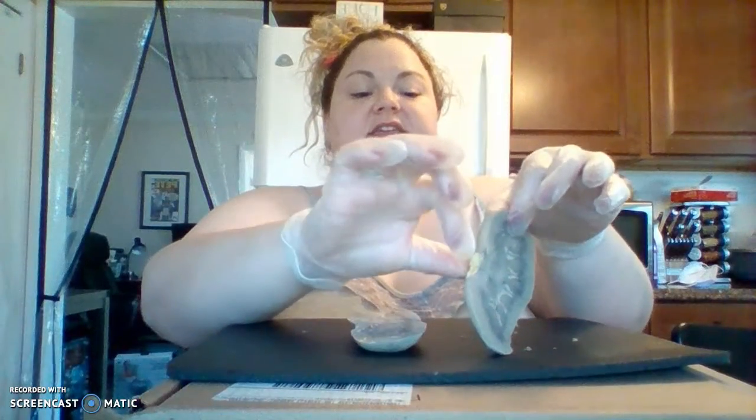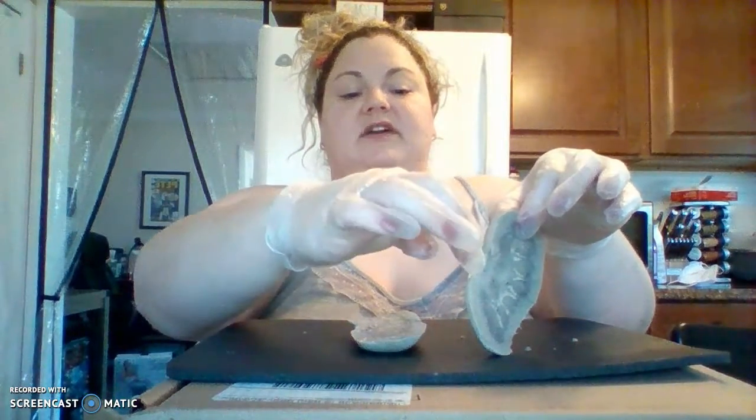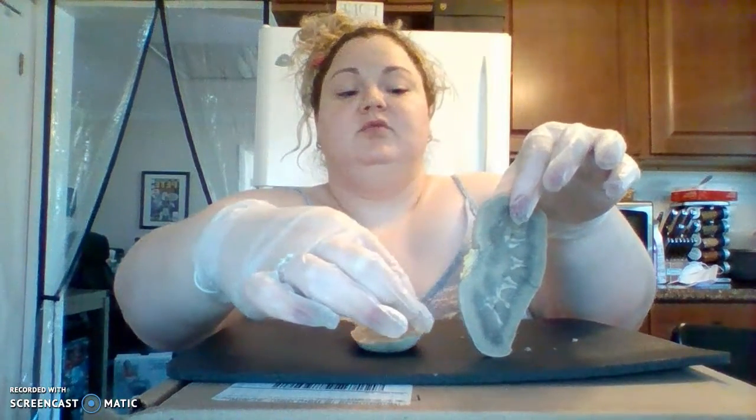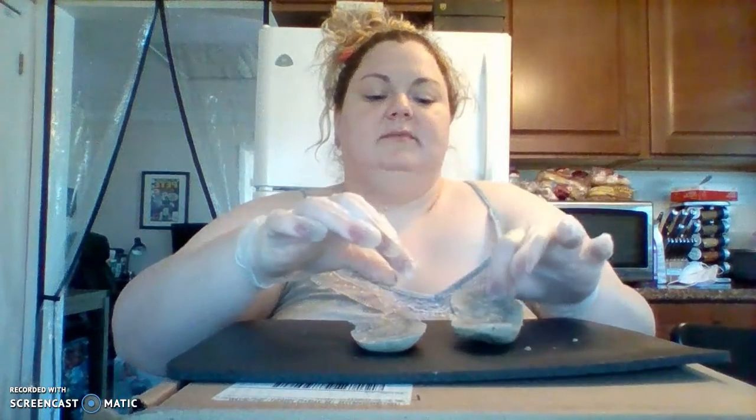and there is the superior portion of the ureter right over here, which would come off now into the bladder, which would then transfer into the urethra, which would excrete urine. So the kidneys are a filtration system.